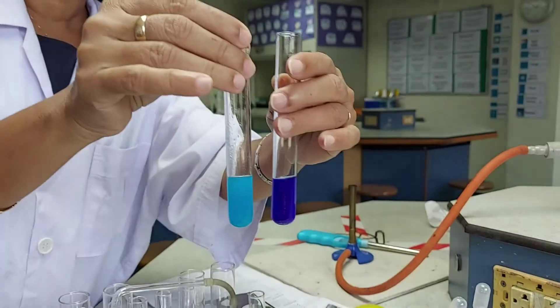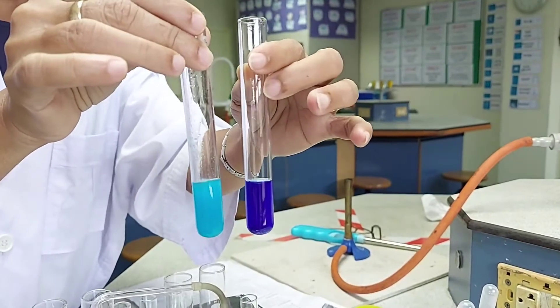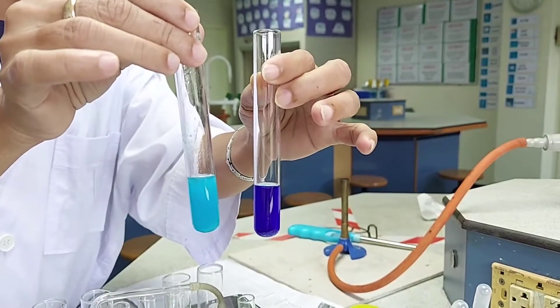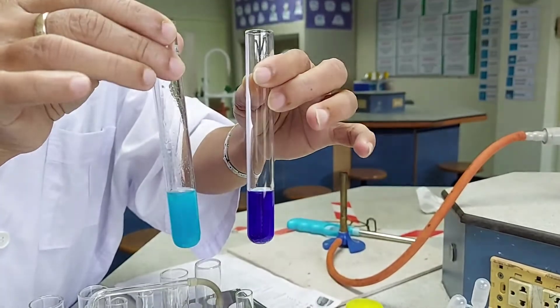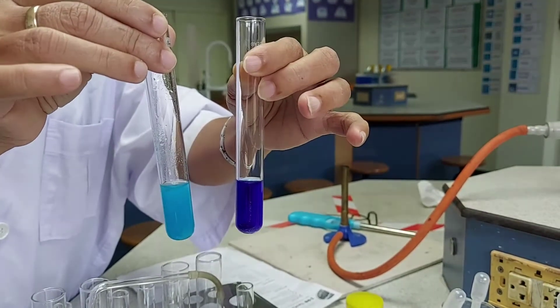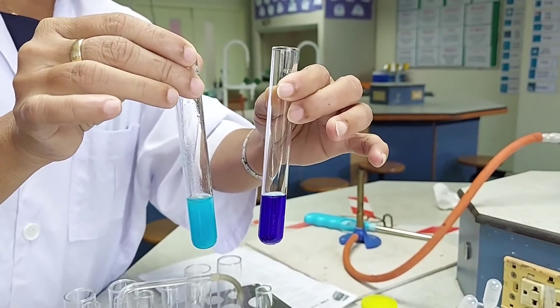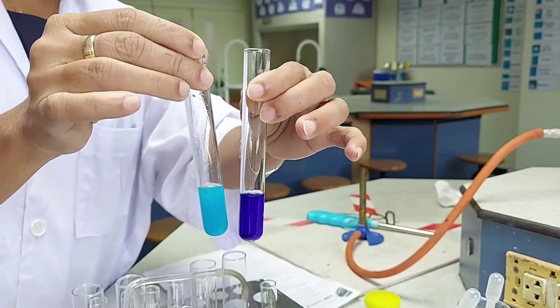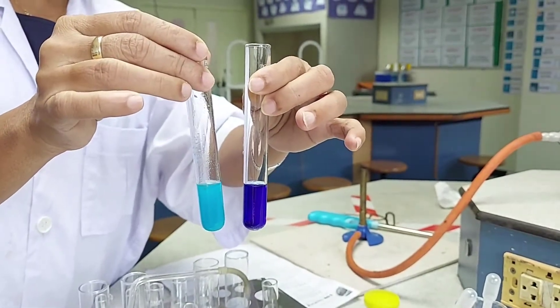We can conclude that the metal ion present in this given solution is copper — Cu²⁺. With sodium hydroxide, copper gives a light blue precipitate which is insoluble in excess. Whereas with ammonium hydroxide, adding drop by drop gives a light blue precipitate, and as you add excess ammonium hydroxide the precipitate dissolves giving a deep blue solution. So the copper ion is present in the given solution, as confirmed by these observations.